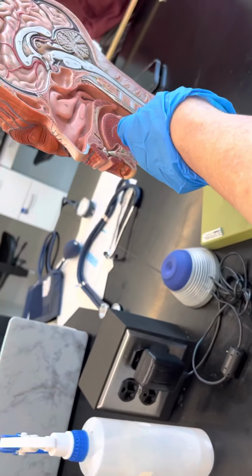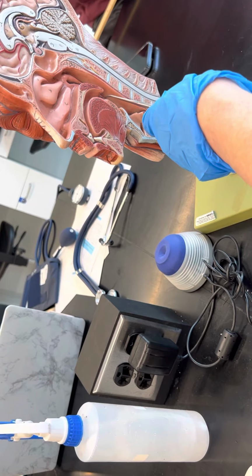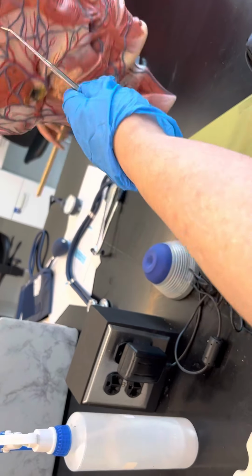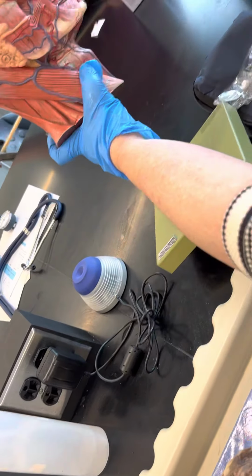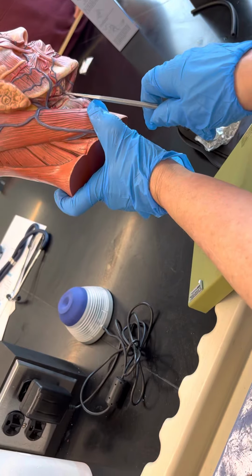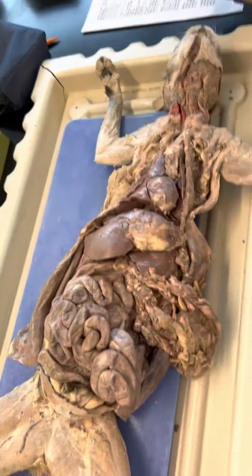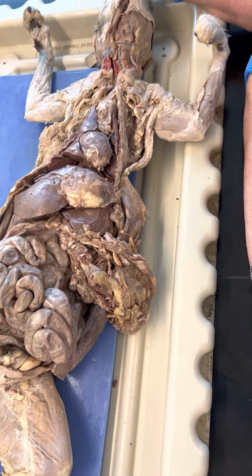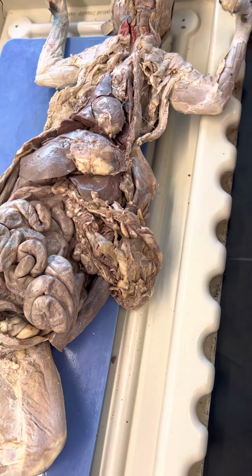These are your pharyngeal, these are your adenoids, your pharyngeal tonsils. Okay? This would be your palatine. And your submandibular should be, humans have a submandibular, see it right there? But I think they're more reasonable on here. I think you can see them on there. We do have some that are a little better than that though. Yeah, but you have to look at all the models because you don't know which one they're going to use.